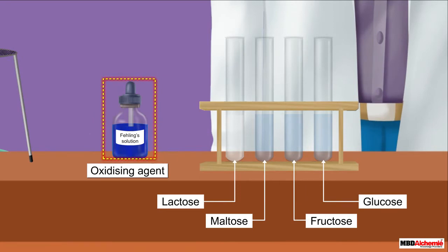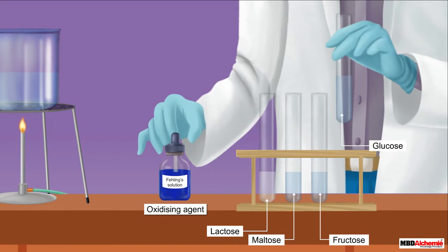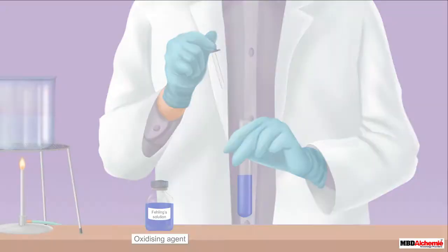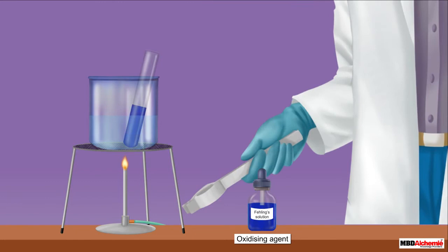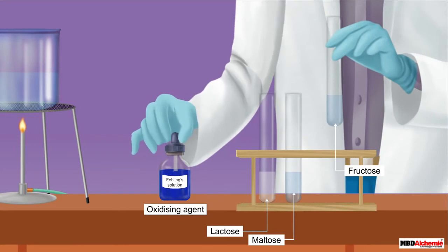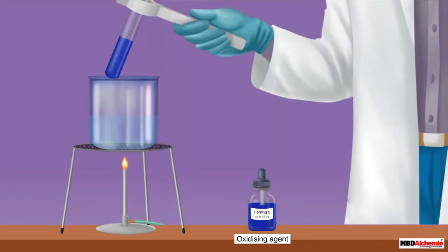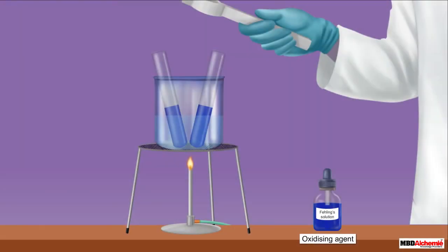Fehling's solution is a blue liquid. Let us first consider glucose. On mixing an aqueous solution of glucose with Fehling's solution and then warming the mixture for some time, the blue color of Fehling's solution changes to red. If the same reaction is carried out between an aqueous solution of fructose and Fehling's solution, the same result is obtained.